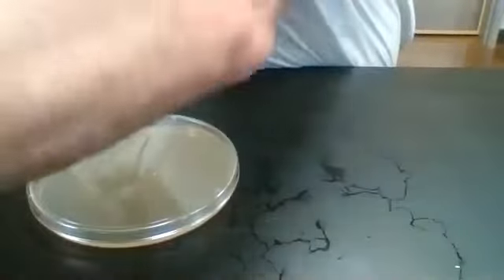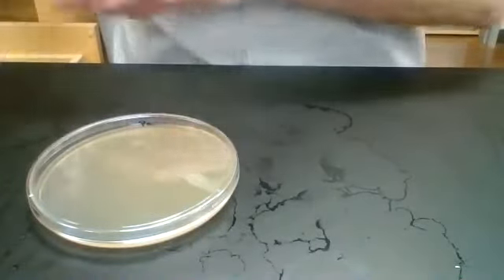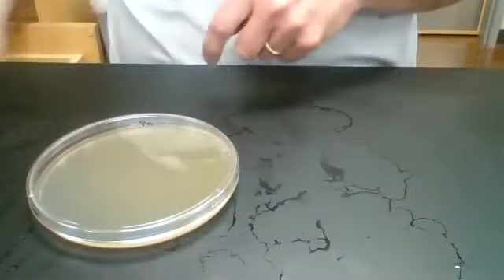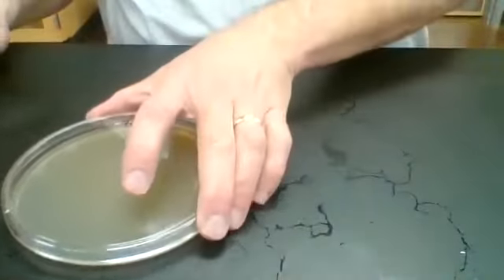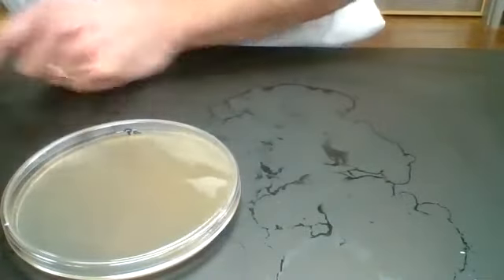Okay, let me start my Bunsen burner. Okay. Open up my Petri dish. Actually, I'm going to do this Pac-Man style.